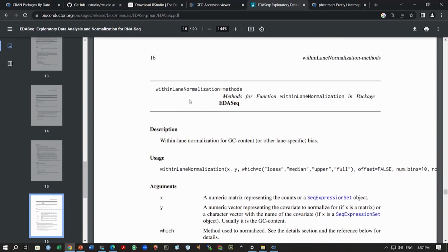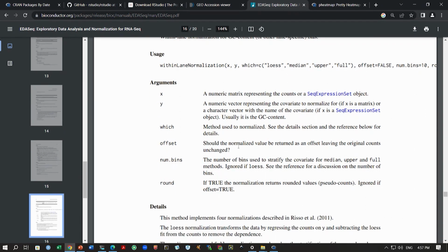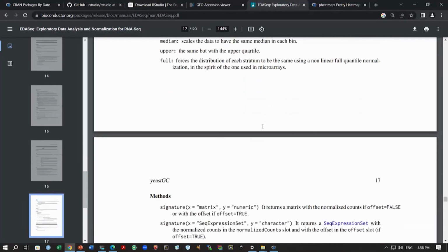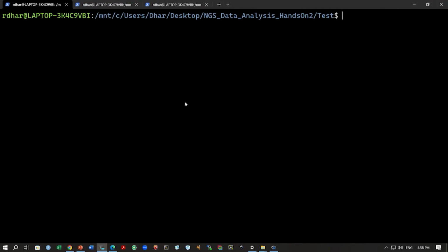Okay, so, we will do that, and then once we do that, then we need this withinLaneNormalization function. Okay, this will do this normalization function, and you can see these different methods that can be used for doing this within lane normalization or bias correction, which will give you that, right. And then x is the data that we want, right, and y is the variable for which we want to do the bias correction, right. So, we will take the example of GC content here, and we will do the bias correction for GC content in our data.